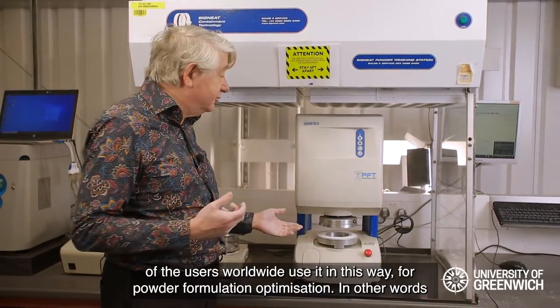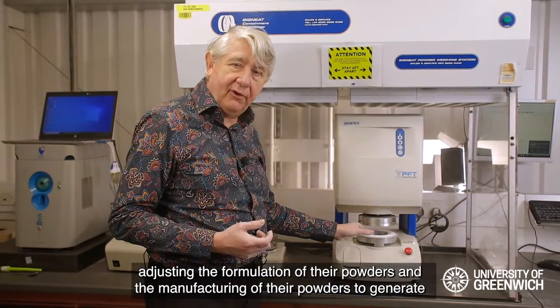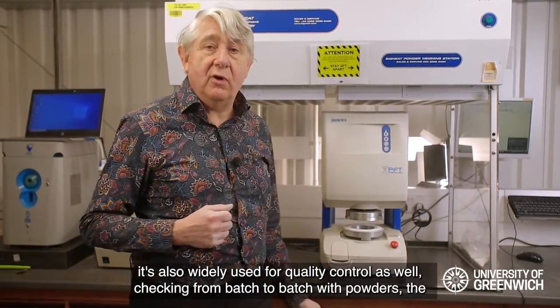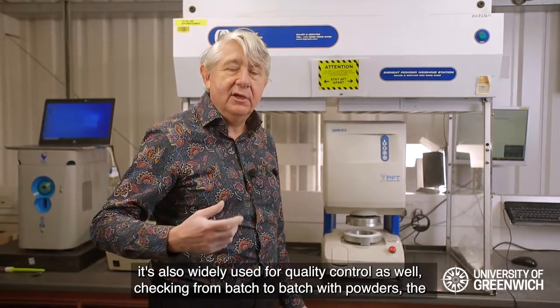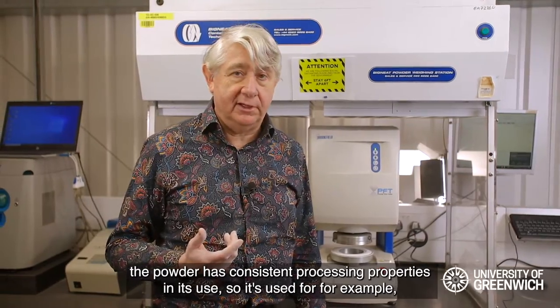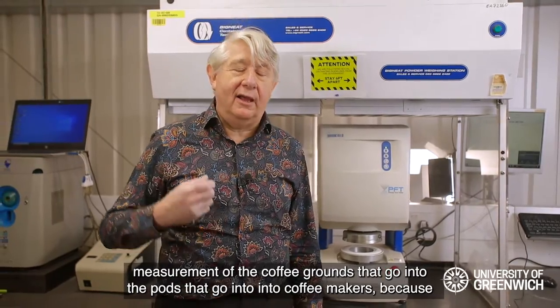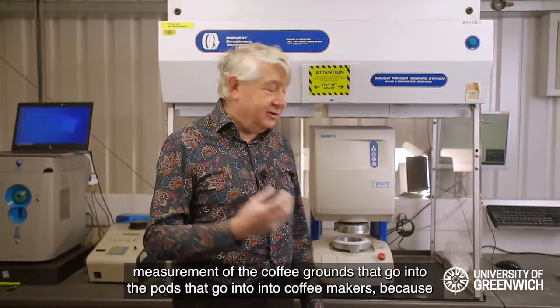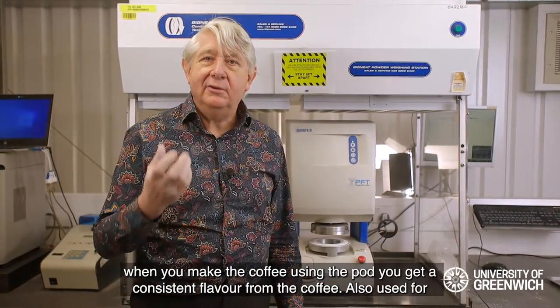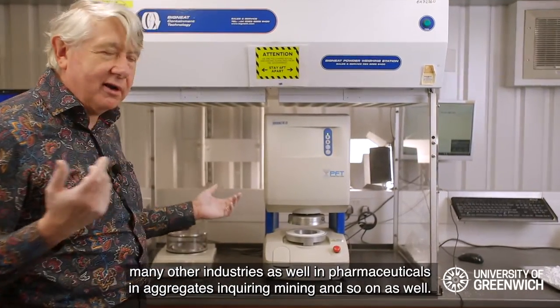Alternatively, this instrument is very frequently used for powder formulation optimization — adjusting the formulation and manufacturing of powders to generate user-friendly handling properties. It is also widely used for quality control: checking from batch to batch that powders have consistent flow properties, which often means consistent processing properties in use. For example, it's used to measure the coffee grounds that go into pods for coffee makers, because consistent flowability indicates consistent particle properties, giving a consistent flavor from the coffee. It's also used across many industries including pharmaceuticals, aggregates, quarrying, and mining.